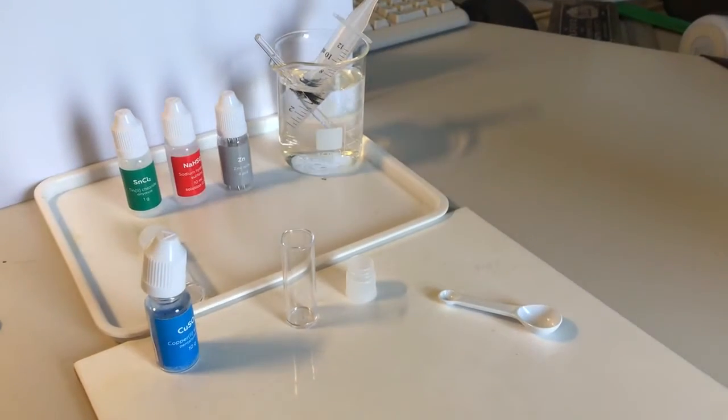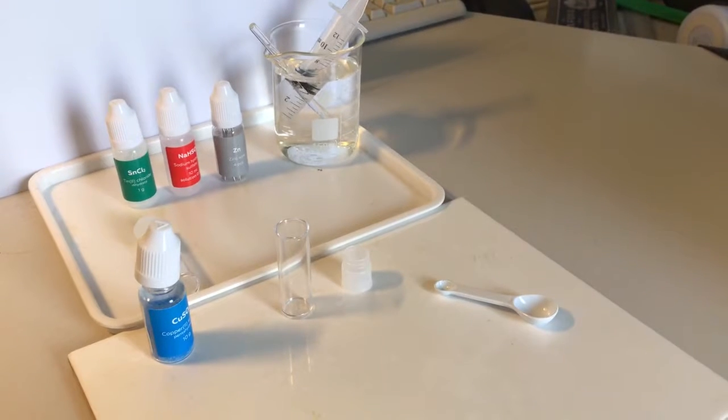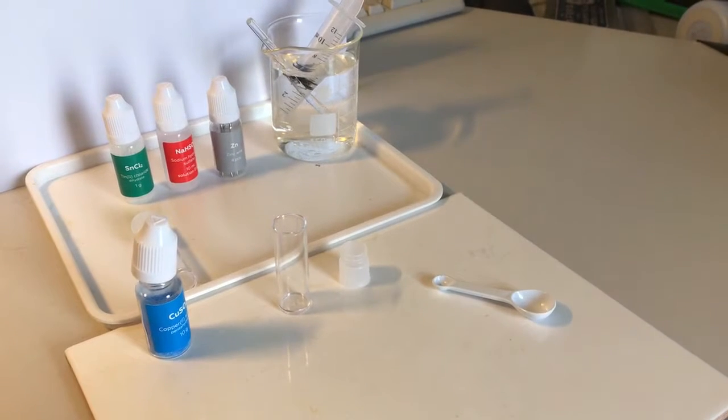Firstly we are going to prepare a copper sulfate solution by mixing a small spoon of copper sulfate with four milliliters of water.